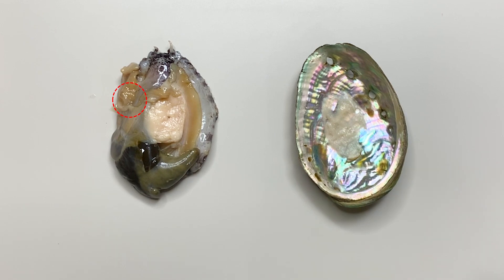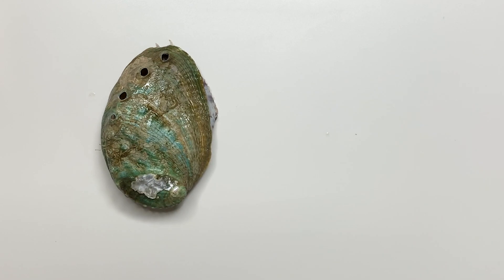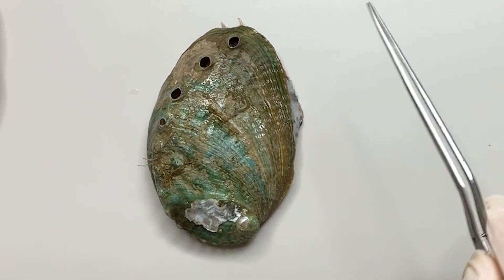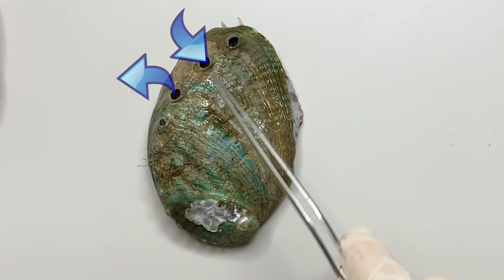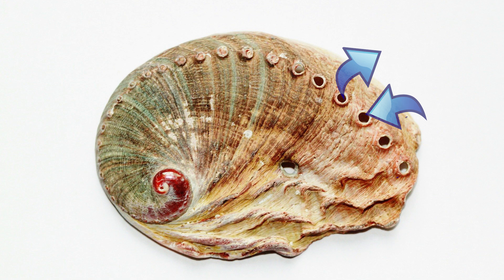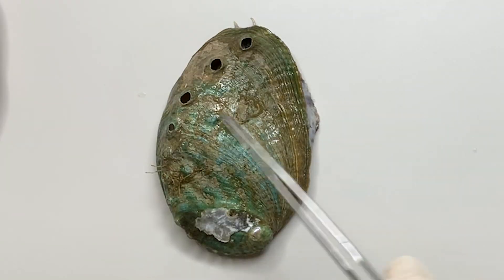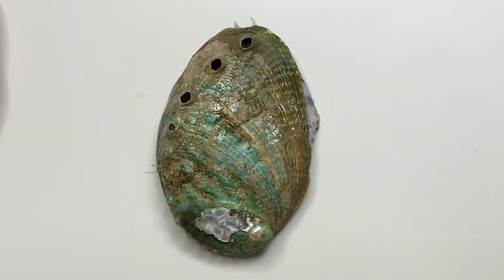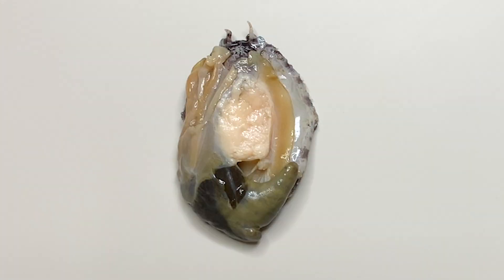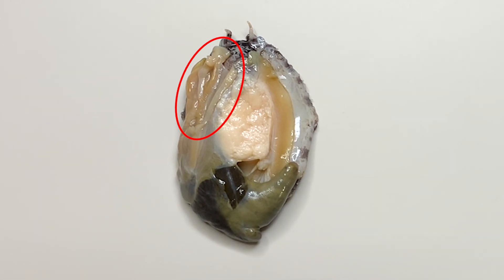This ambiguous location of the anus can be understood by observing the shell of the abalone. You can see that there are several small holes in the shell. The holes create water streams that allow water to flow in and out of the shell. Therefore, abalone uses the water of the shell to breathe through gills and makes excretion. Sperm or eggs come out through these holes too, because the abalone has a hole in the side of the head that connects to the outside of the shell. Gills and anus are located on the sides of the head.